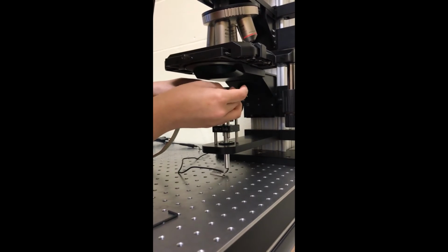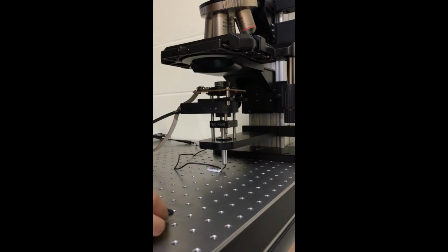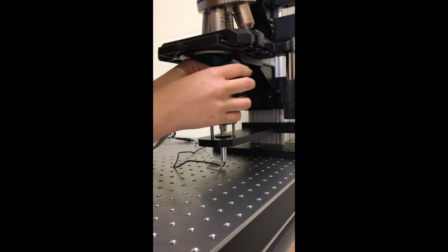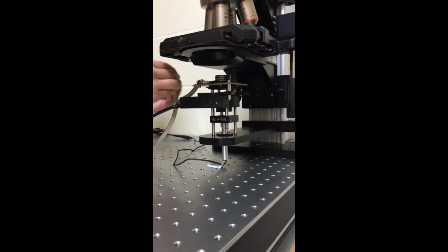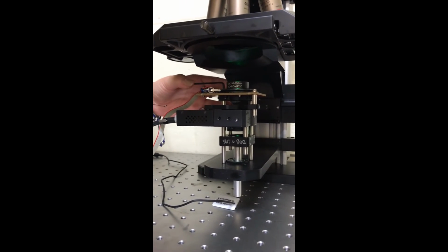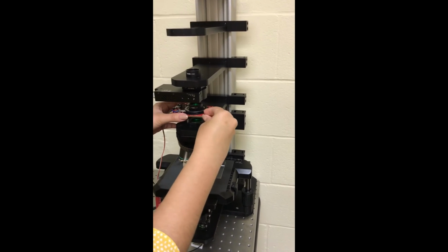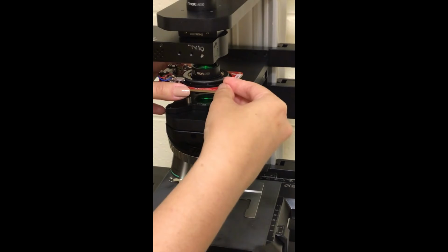the microscope. Firstly, we insert the quarter wave plates closer to the illumination source. As before, we rotate the orientation of the quarter wave plates in order to find the minimum intensity of the light arriving to the sensor. However, for the quarter wave plates, there are 4 orientation angles that produce an intensity minimum. These orientation angles are 0, 90, 180, and 270 degrees with respect to the calibrated linear polarizer.